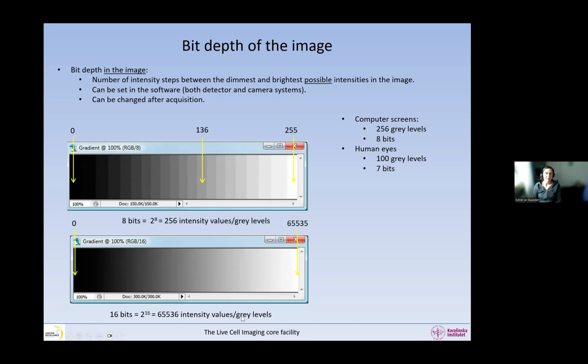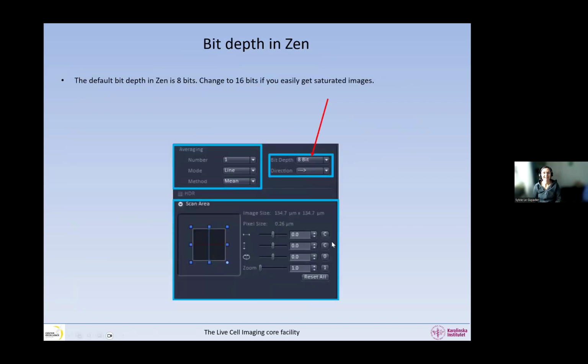So basically, when we have a 16-bit image, anyway, this is a 16-bit image, but it's only displayed in 8 bits by my computer screen, and I can hardly see anything at all.